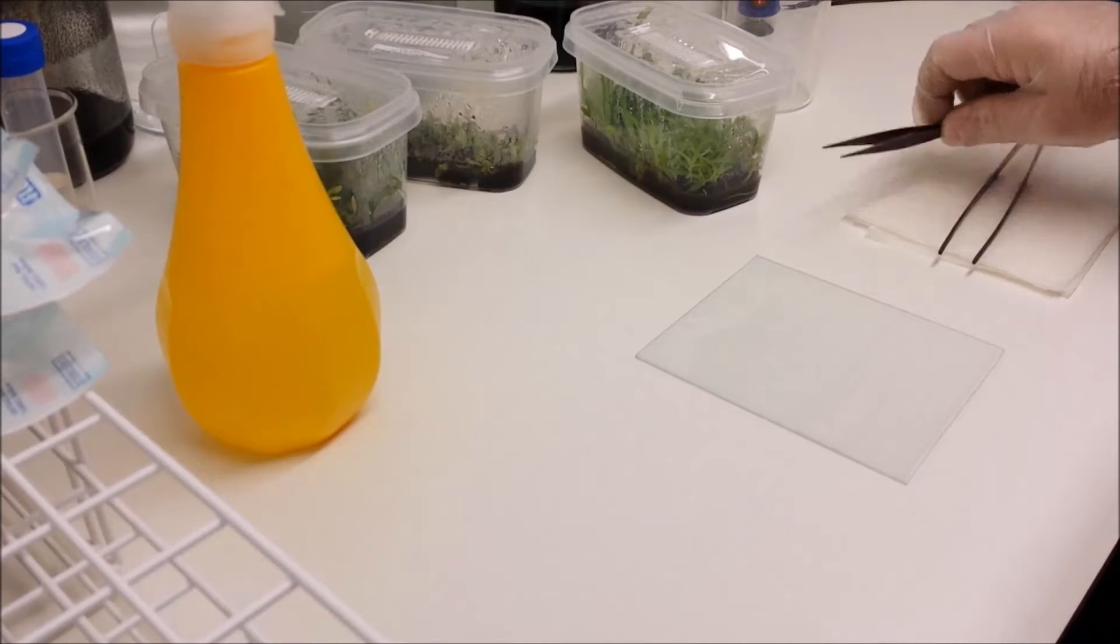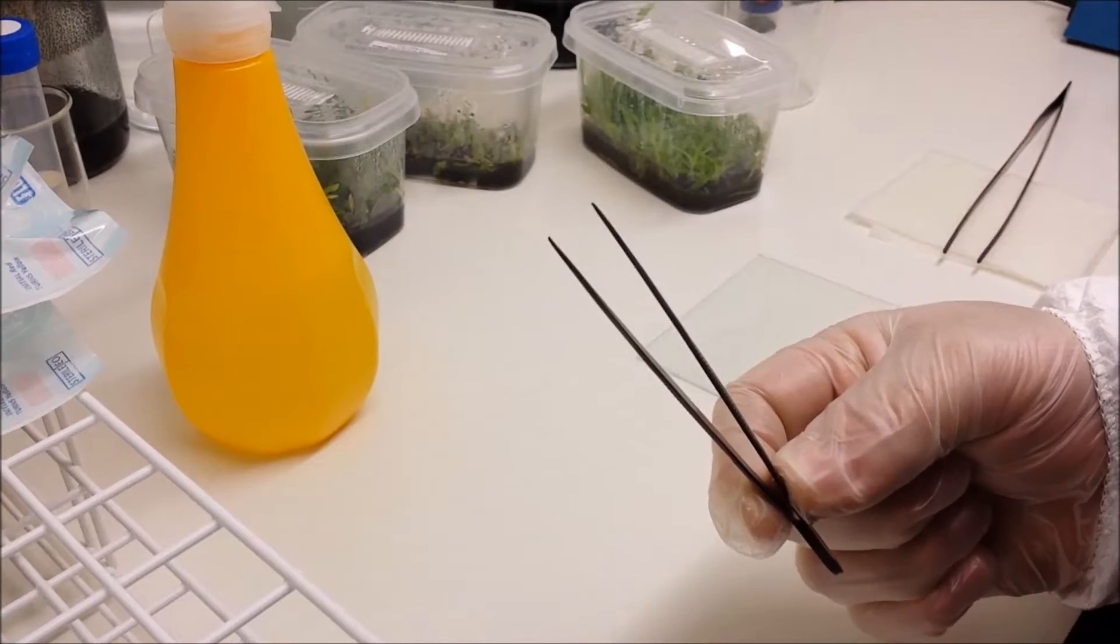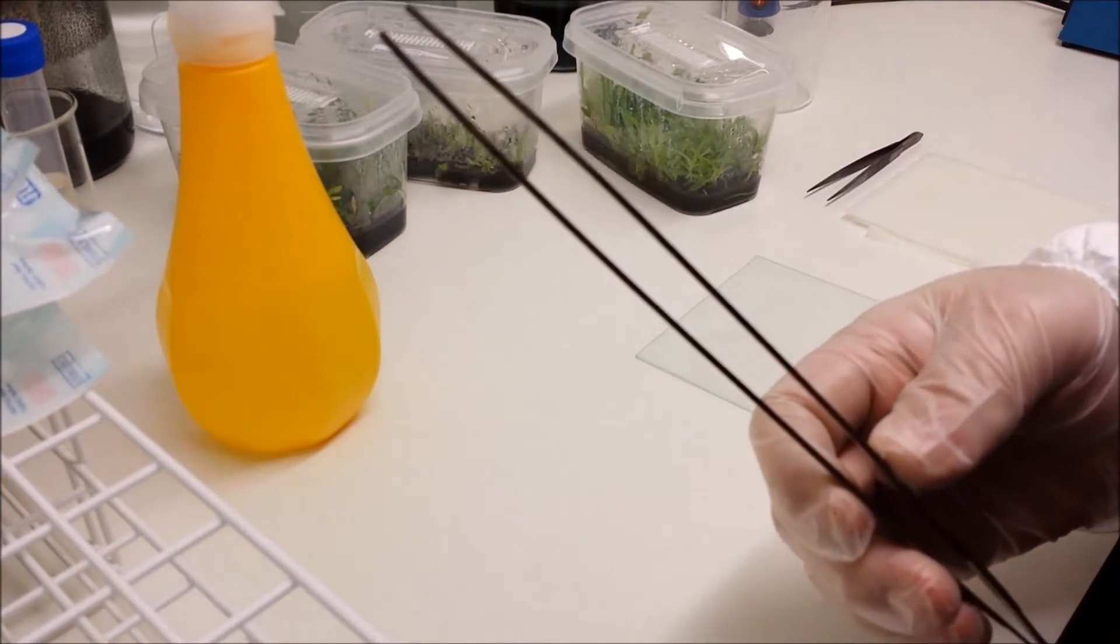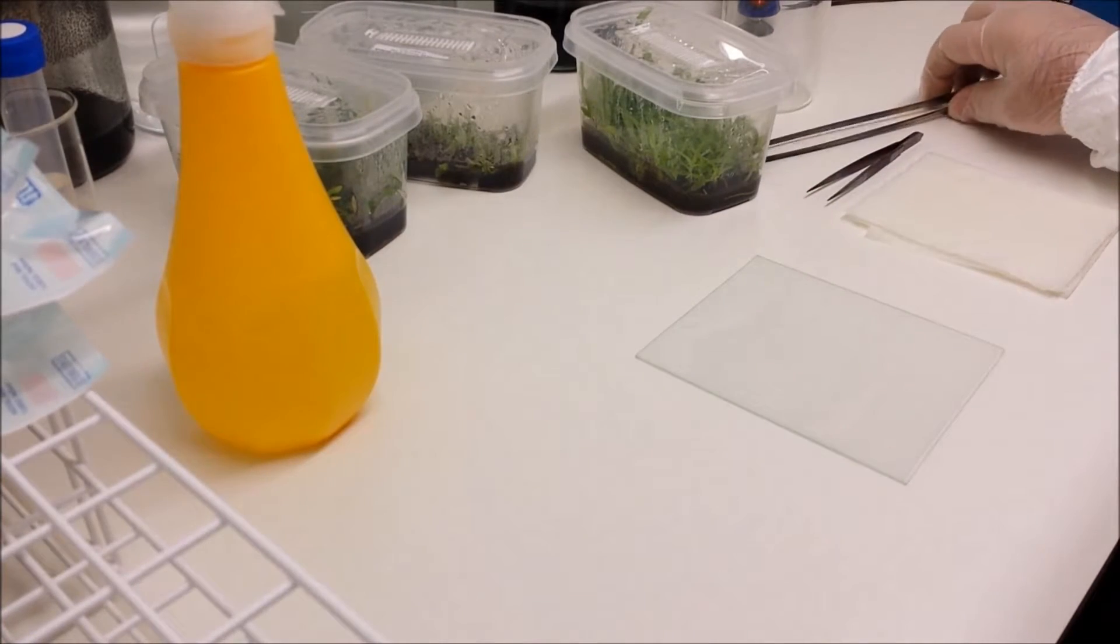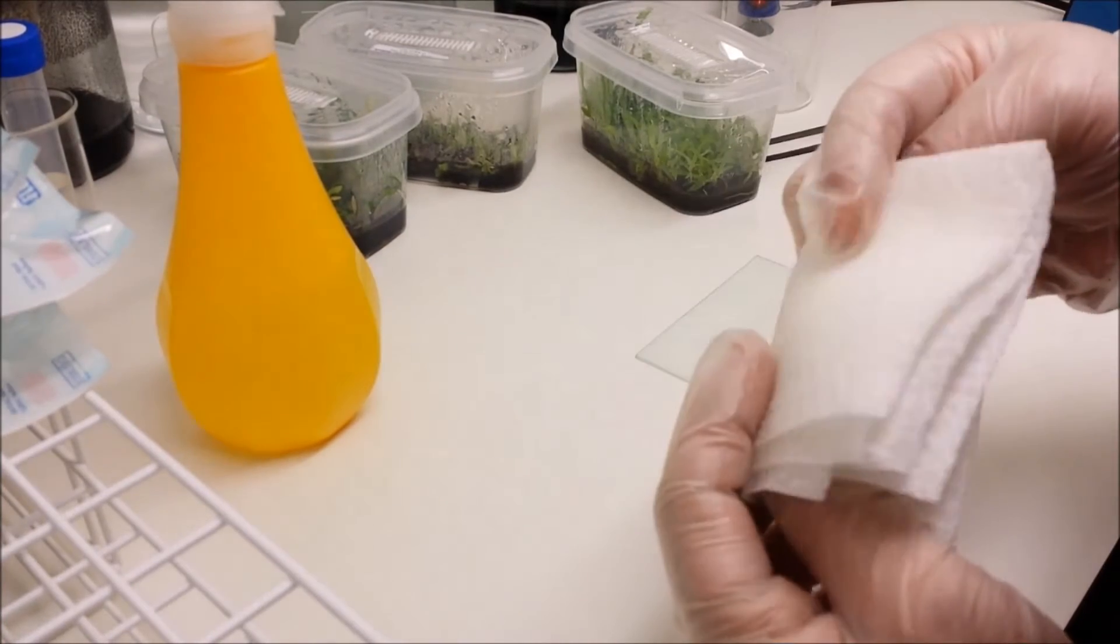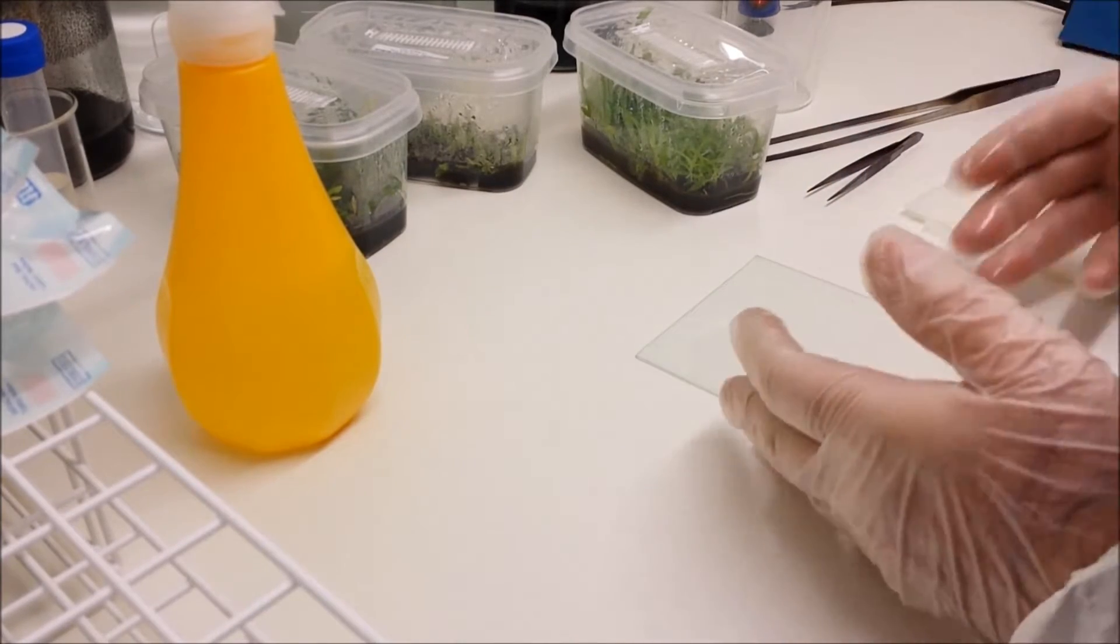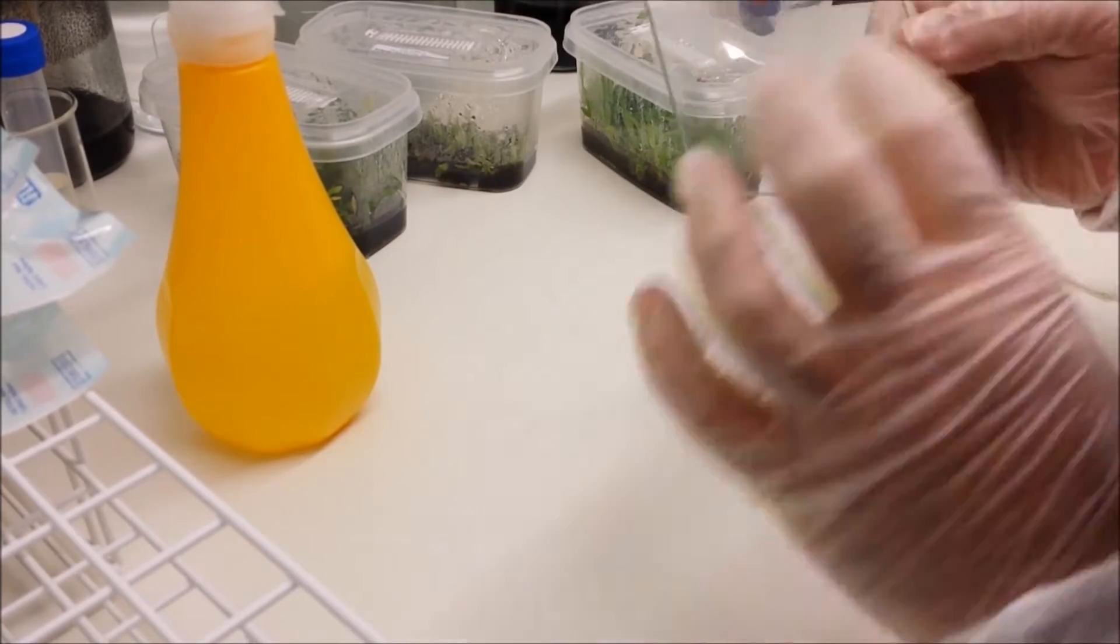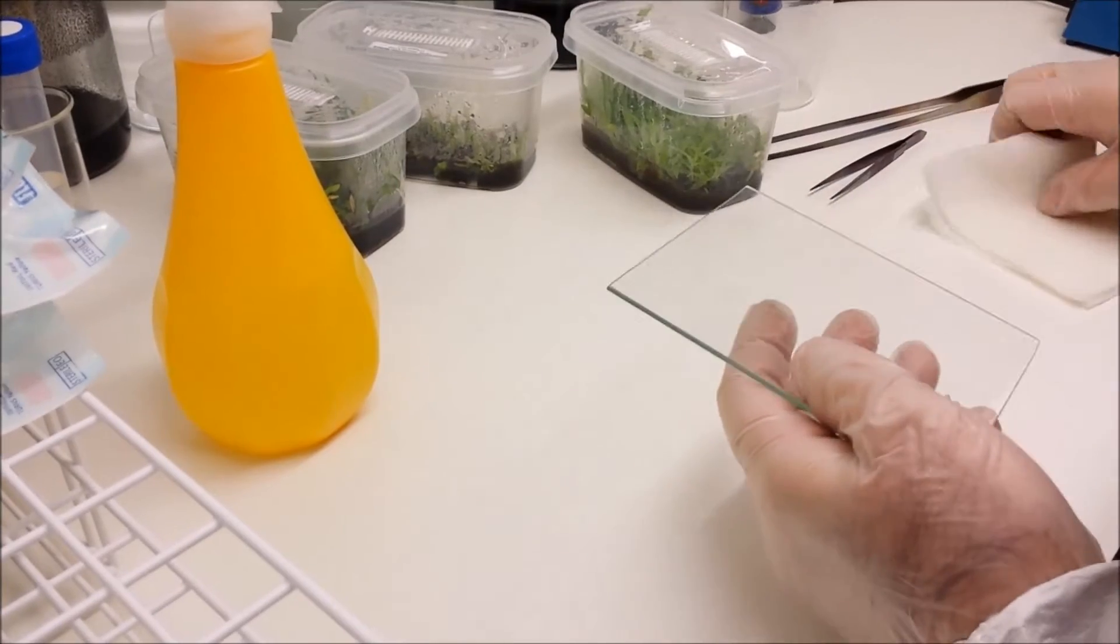We have today's equipment, we have a small pair of delicate tipped tweezers for removing dead bits of leaves and we've also got a larger longer but equally thin pair of tweezers for transplanting the actual plants. We've got some kitchen roll which has been soaked in IPA to sterilize it and also a small sheet of glass which again has been wiped with IPA.